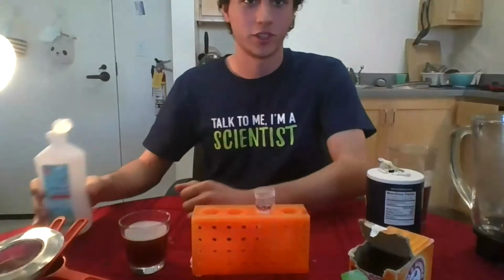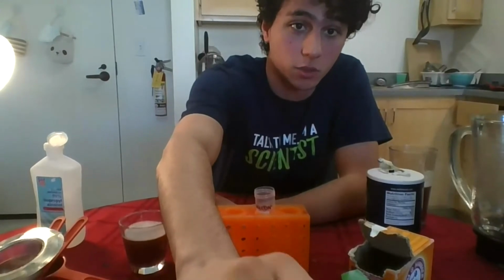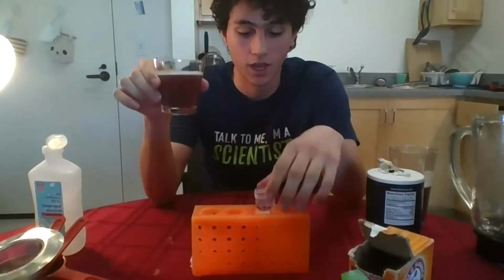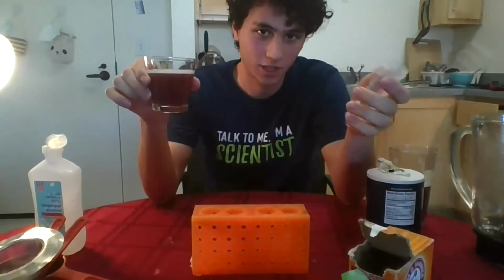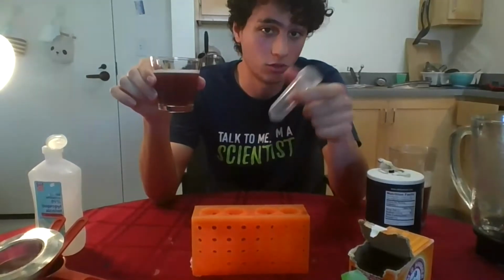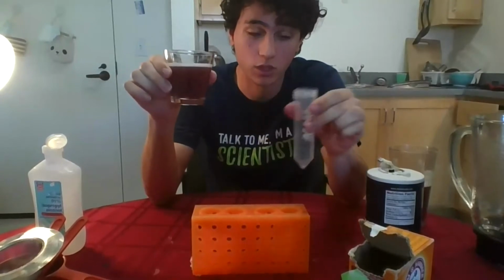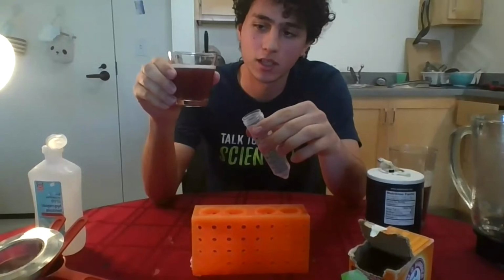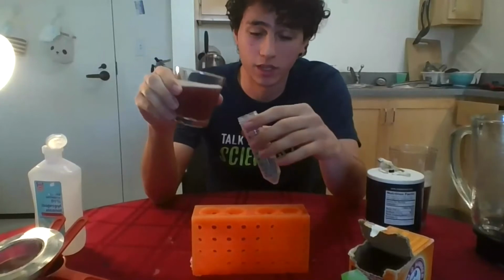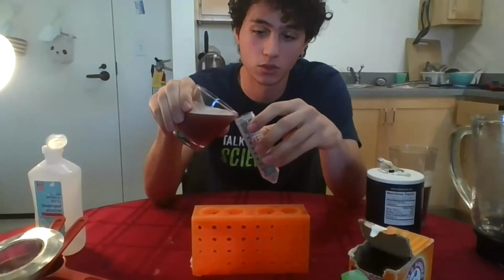Perfect. So as you were talking, I went to the freezer and I got the chilled rubbing alcohol. Now it's cold and we need it cold. And I have the solution with the strawberry blend, and I also have a test tube over here. You don't need to have a test tube. You can have a small, narrow glass container, anything that can hold liquid will do the job. So I'm going to add some of this strawberry blend into the test tube very carefully. I'm going to try not to get the bubbles that are on the top. You may not be able to avoid it, but I think it's going to be fine. Just try not to make a lot of bubbles when you pour the strawberry blend into the test tube. So I'm going to do it slowly.